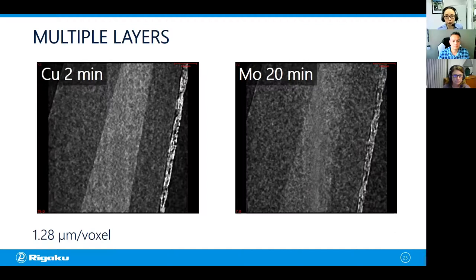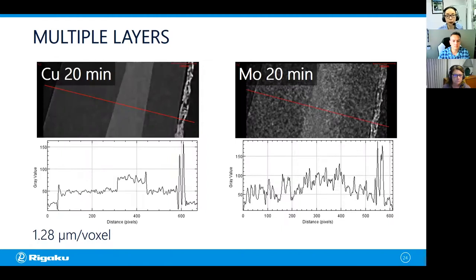Now, just to do apple to apple comparison, I did a 20 minute copper scan as well. And this is the result. If you spend 20 minutes with the copper, you can clearly see that this is UV resin and you have two different polymer layers and paper. And if you look at this profile, you can see the change in gray level. Those two are two different levels. With the molybdenum, when you look at the image, you can kind of tell that the center part is lighter colored, but when you look at the profile, it's really hard to tell the difference or identify the borderline.